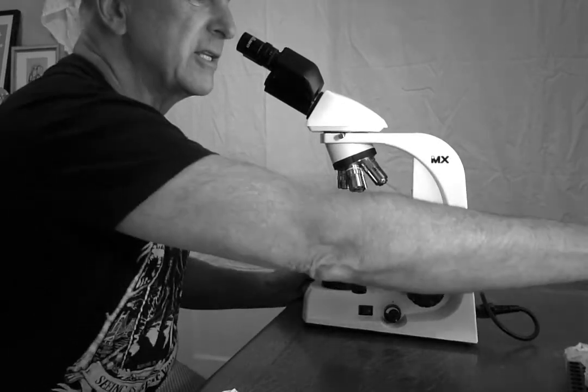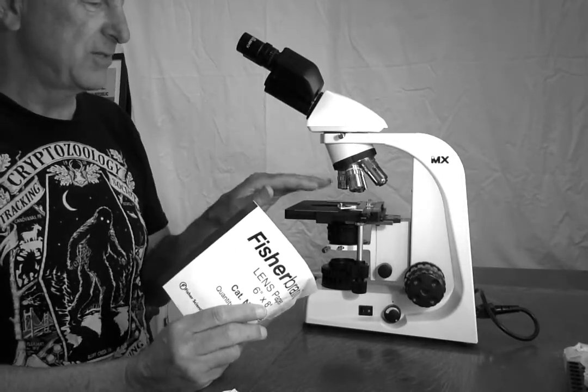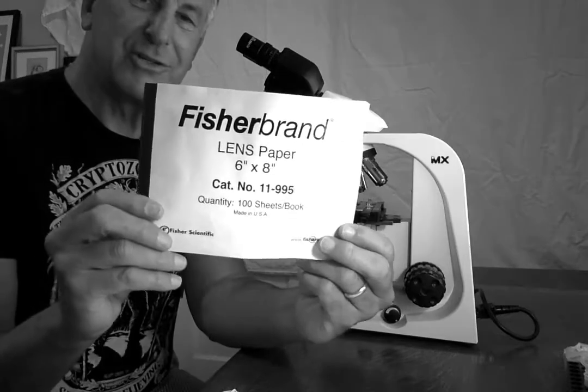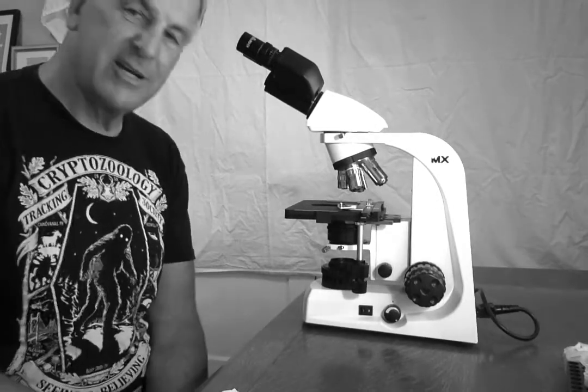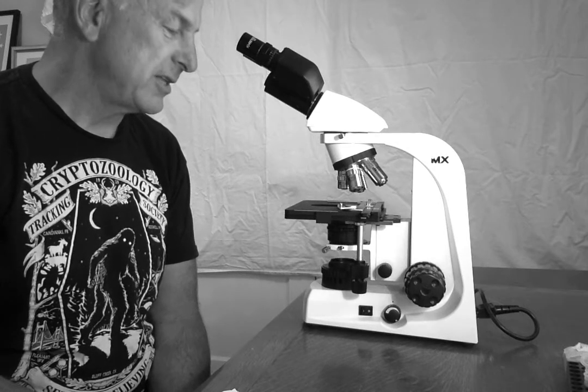Next, if you plan on cleaning any of the lenses, the objectives, the oculars, or any other glass part, you are going to use lens paper and possibly lens cleaner. This will avoid scratching or damaging any of the lenses or any of the glass on this microscope.